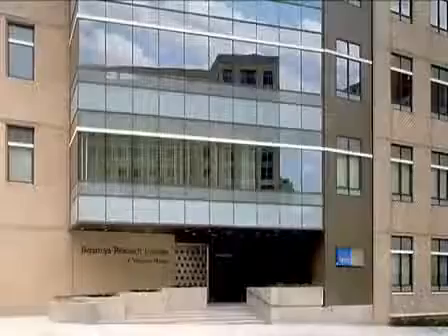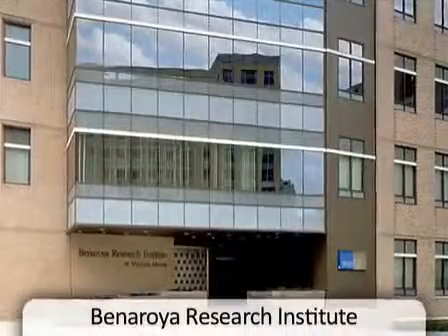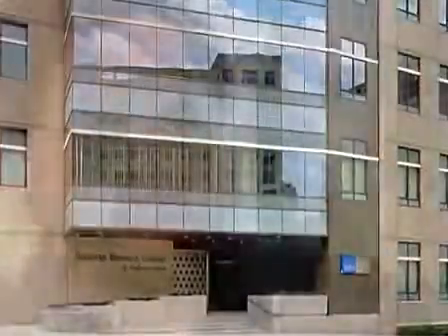And the Tetramers that you use are actually made here at BRI, is that correct? Yes, we're one of a very small number of labs in the country that have successfully made Class II Tetramers. Our intent is to distribute these reagents at cost to any laboratories that are interested in importing this technology.